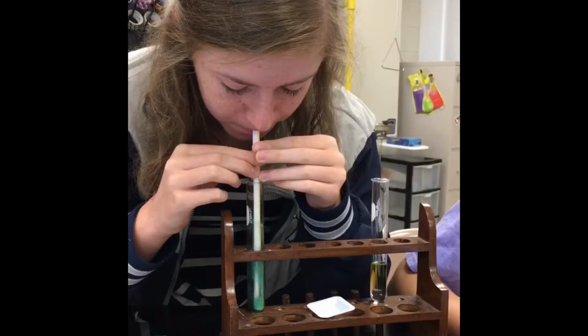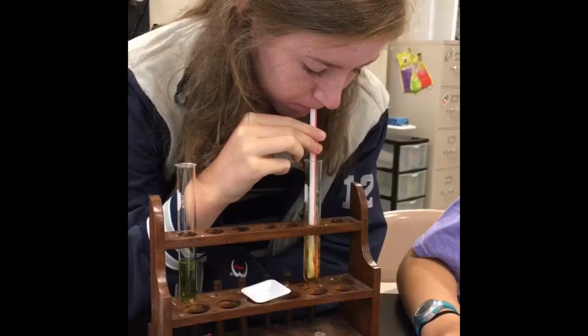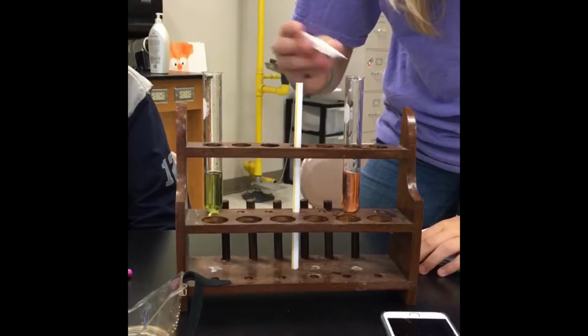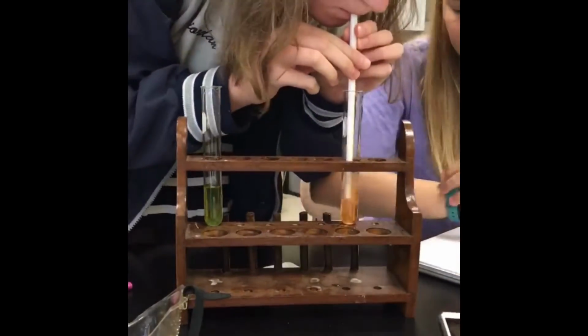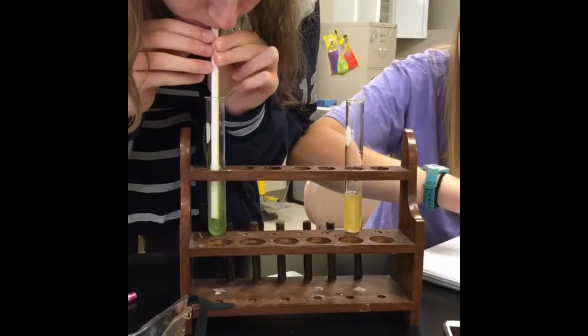It takes 15.34 seconds for it to change pH. The distilled water takes 4.83 seconds to change pH. We now add the calcium carbonate to both solutions. After blowing into solutions, it took 2 seconds for the distilled water to change and 4 seconds for the salt water to change pH.